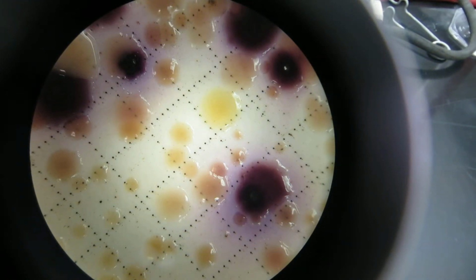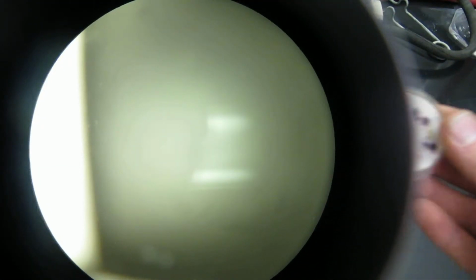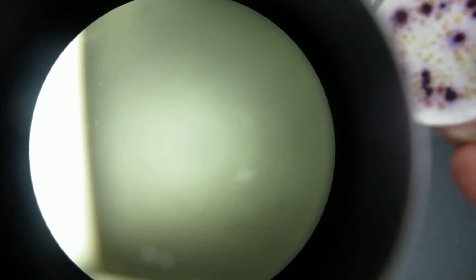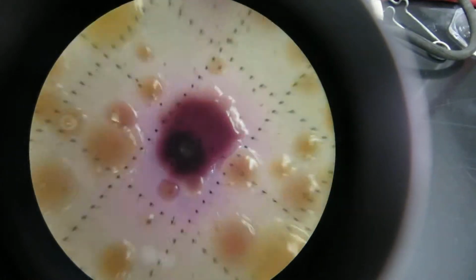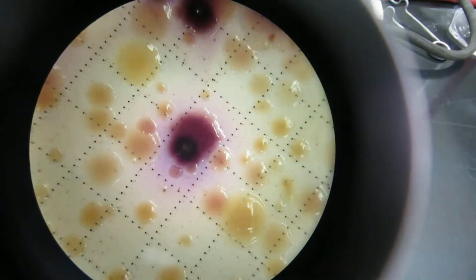This is to do the membrane filtration method to look for E. coli. So this is the mTEC plate. It looks like this. I don't know if you can see that next to the microscope here. I have it in a dissection microscope. So it's a pretty small plate. Let me zoom in and zoom out on this dissection microscope, and you can see these colonies. These purple ones are the ones that you want to count.